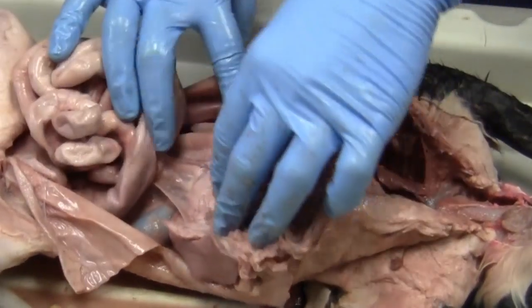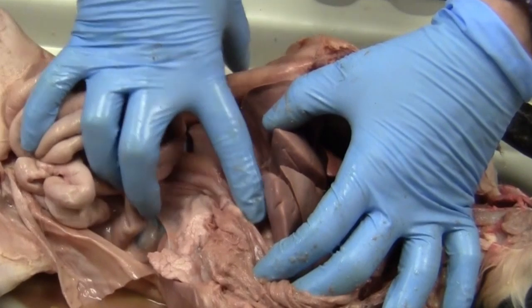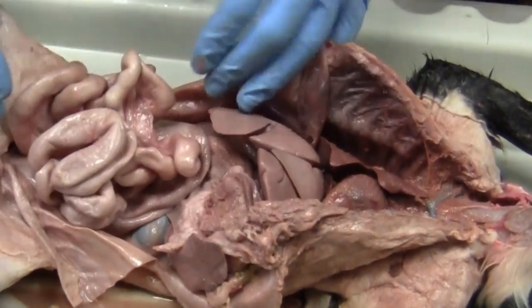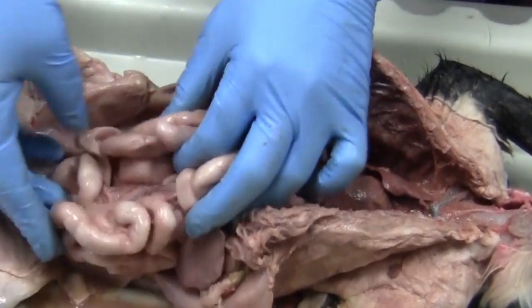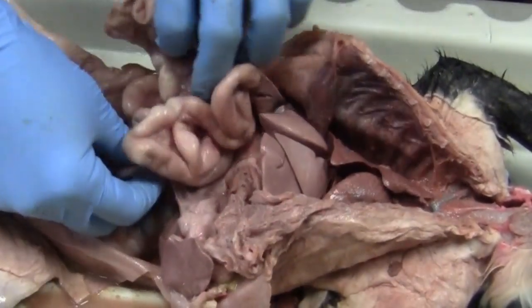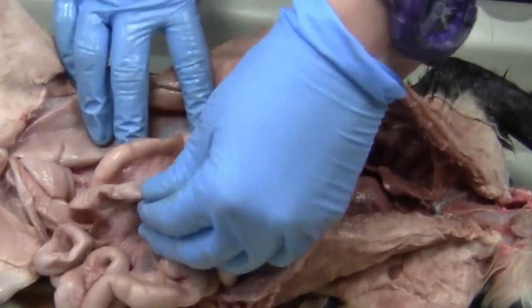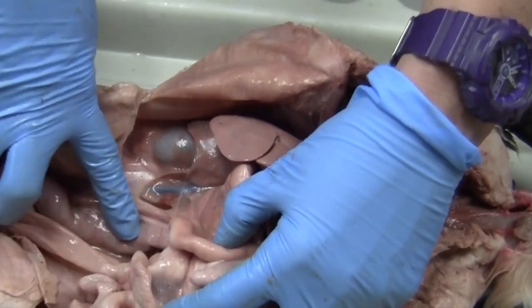And really this pancreas ends, or actually maybe starts, right here where the stomach and the small intestine attach, or where the food is going to be coming from the stomach into the small intestine. That's where the pancreas is going to be, because obviously it's going to produce insulin and some other digestive enzymes that you're going to need in the small intestine. Okay, so like I said, we have our small intestine here. And then also we have our large intestine and/or colon. That's going to be the last part of our digestive tract. It's a larger structure here that's going to have all of the food stuff exit the body. So here's the back or the bottom part of that colon.